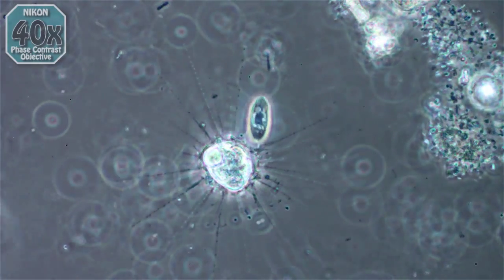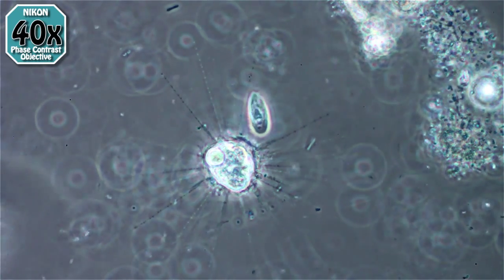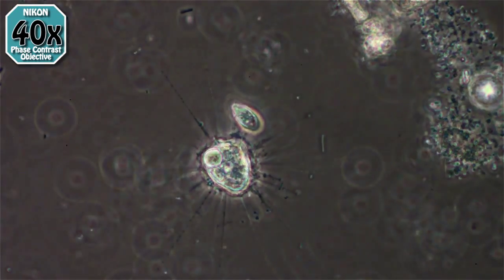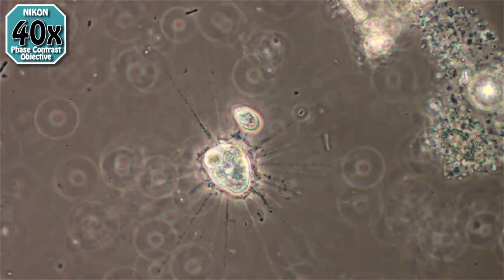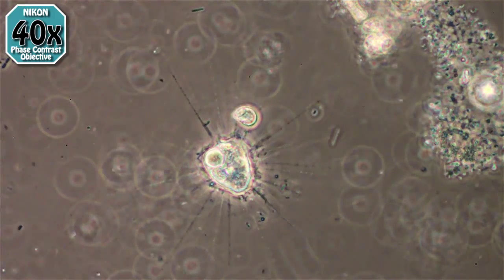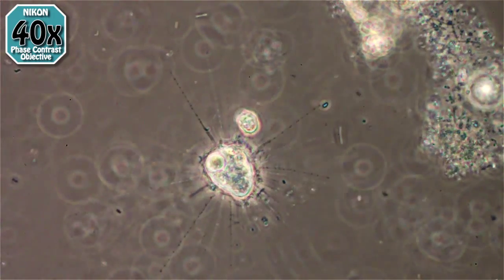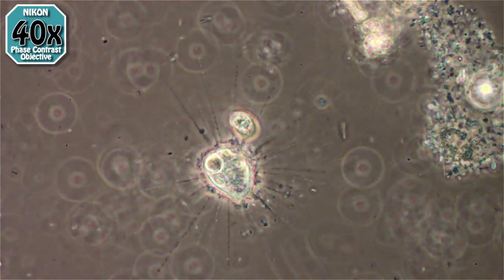Here we go to 40x phase contrast, and you'll see this little ciliate stuck on the spines — it's dying, vibrating there. It's caught on a spine or two, and the digestive fluids will slowly digest it and bring it down into the main body as we watch.